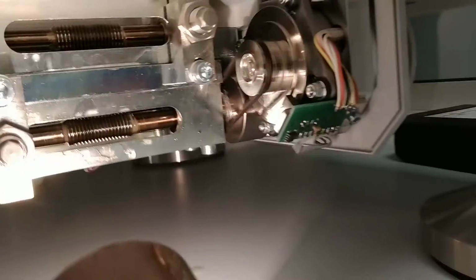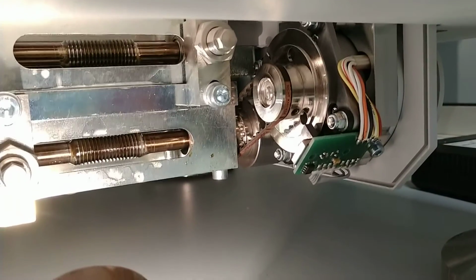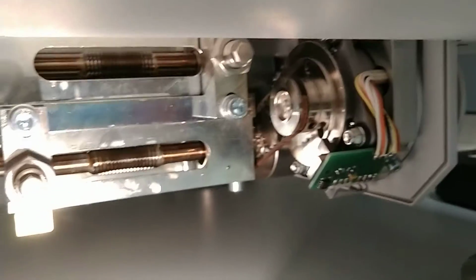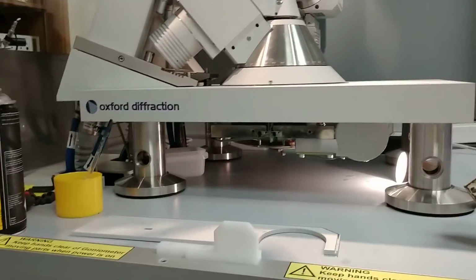Okay. So that great big dial that I was talking about that's moving in the front with Omega, is it worth putting any oil on or brushing any oil? Don't do that.